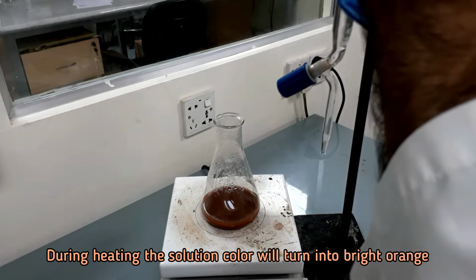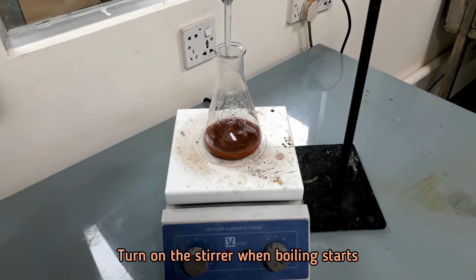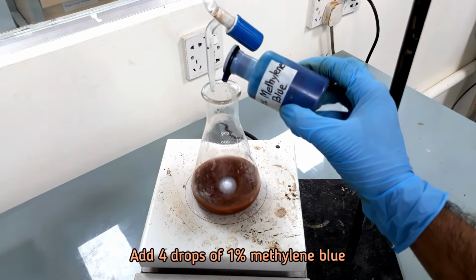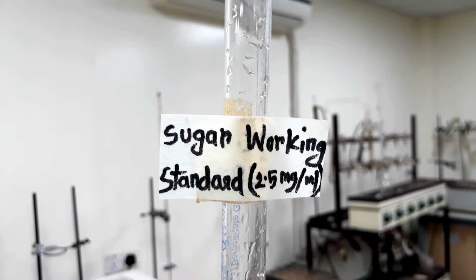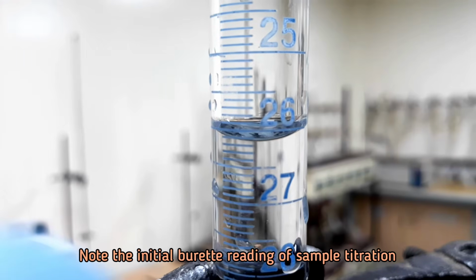Prepare a burette taking sugar working standard into it. Turn on the stirrer when boiling starts. Now add 4 drops of 1% methylene blue. Note the initial burette reading of the sample titration.